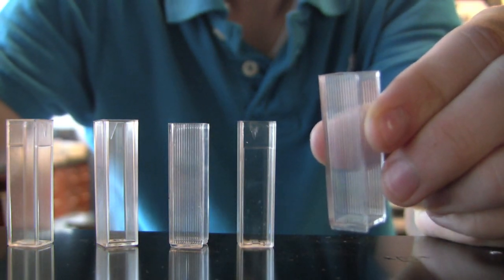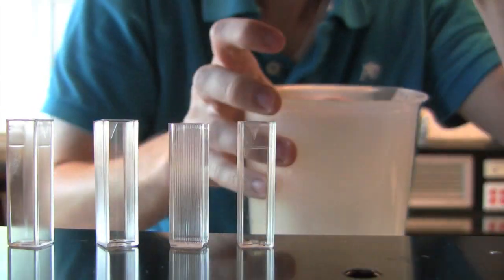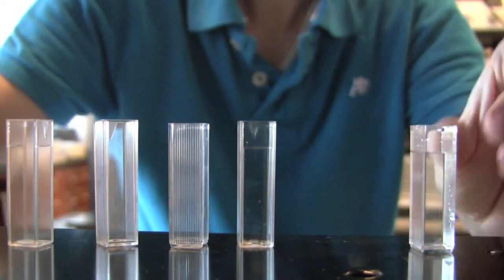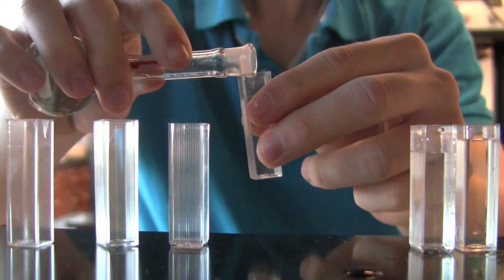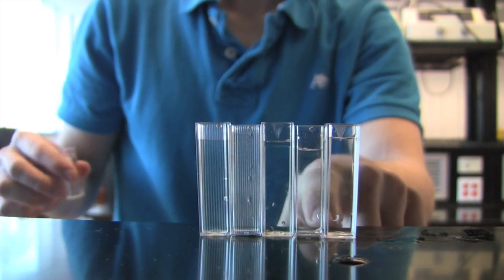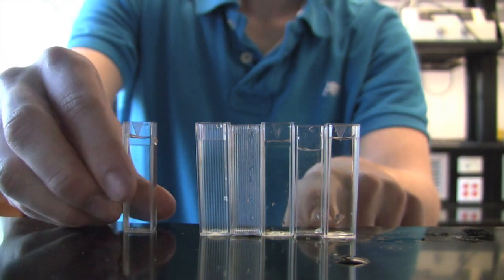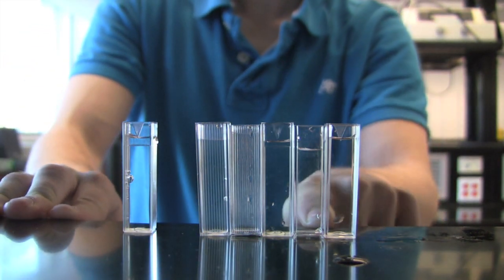Repeat this process with all the cuvettes you have: rinsing, shaking and filling up. When all the cuvettes have been filled with the corresponding diluted concentrations, fill your final sixth cuvette with the unknown solution.